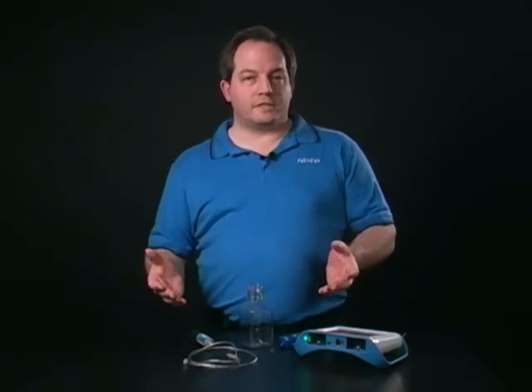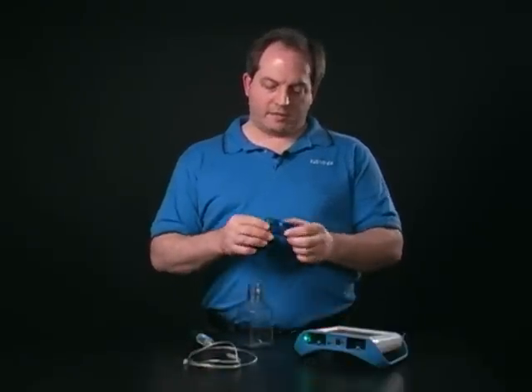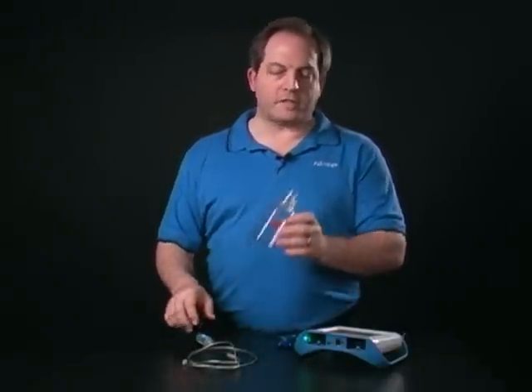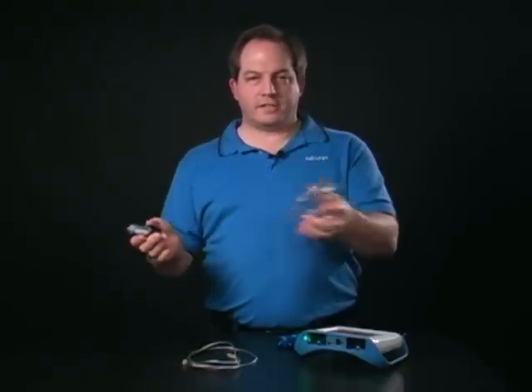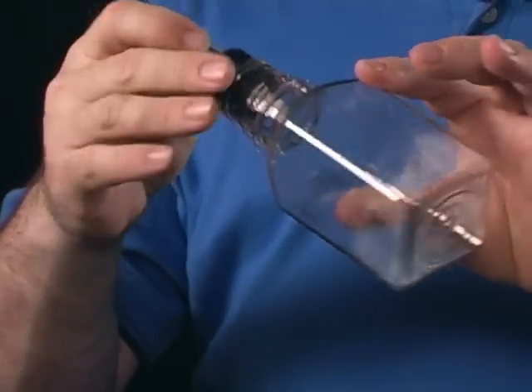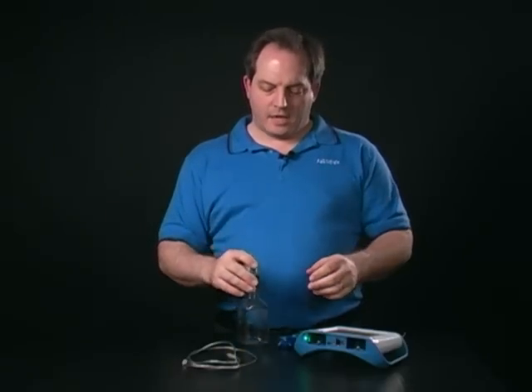To get the best results from the sensor, I'm going to use the calibrate button on it to calibrate it. I'm going to go ahead and go outside with the sample bottle that comes with the sensor, and collect a nice sample of fresh air, and I'm going to trap that using the sensing element. I'm going to bring it back inside and connect that to my interface.